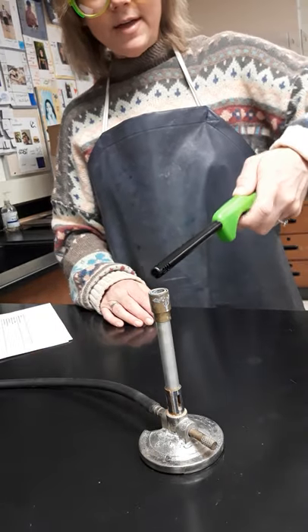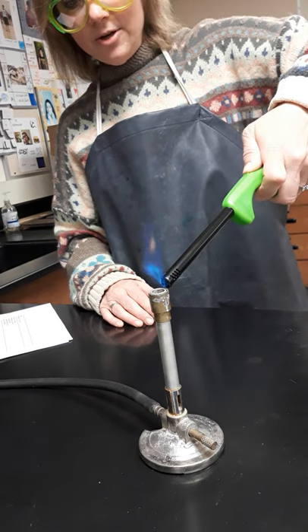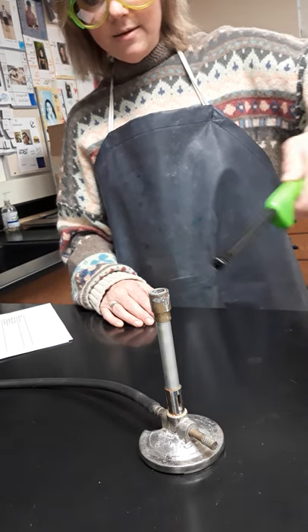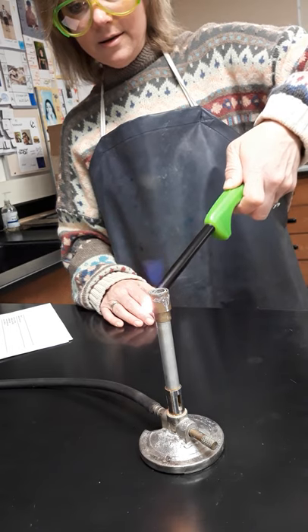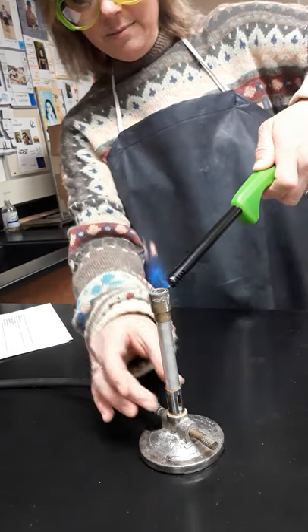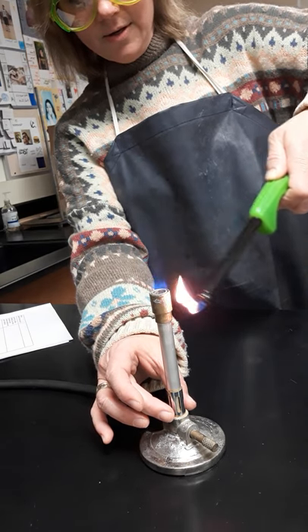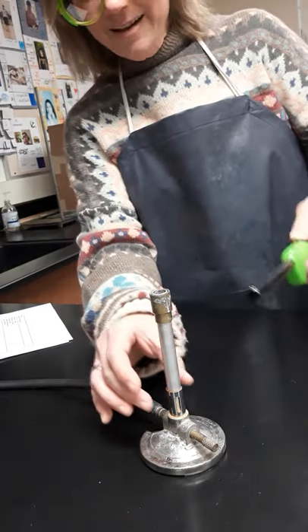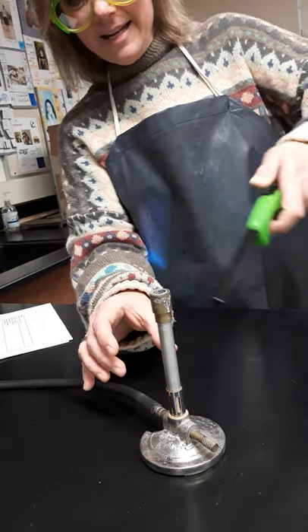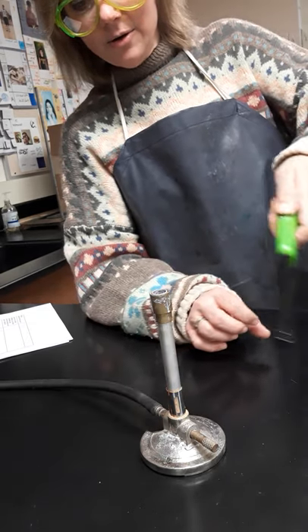So now I've got methane mixing with oxygen and I'm going to add some energy. Maybe I have too much oxygen. And there we are — though I just blew it out. But anyway, there we are lighting the Bunsen burner. This is reaction number one.